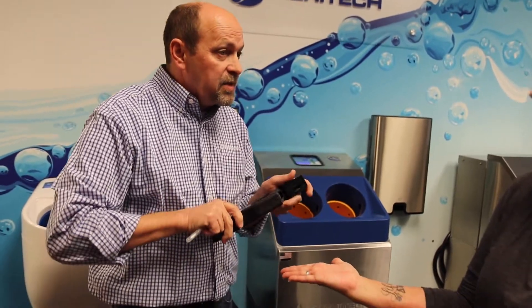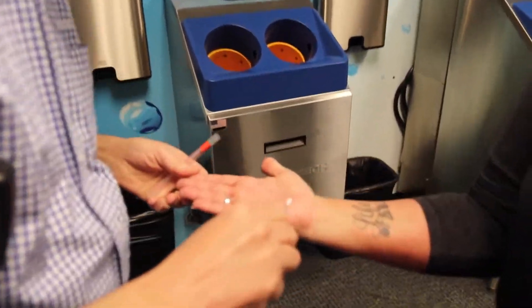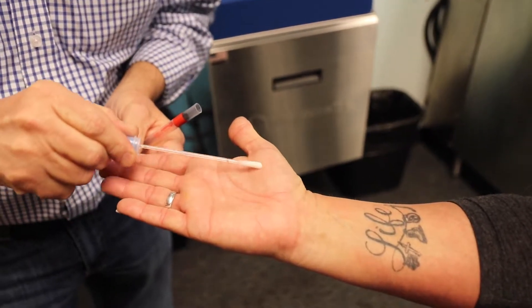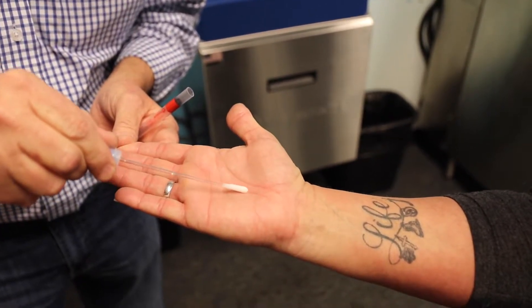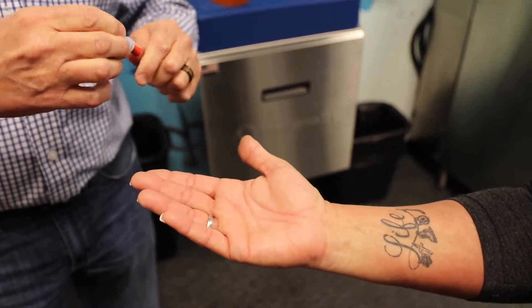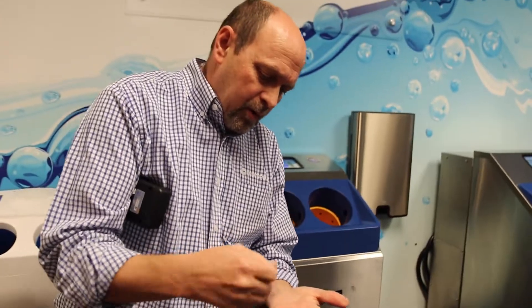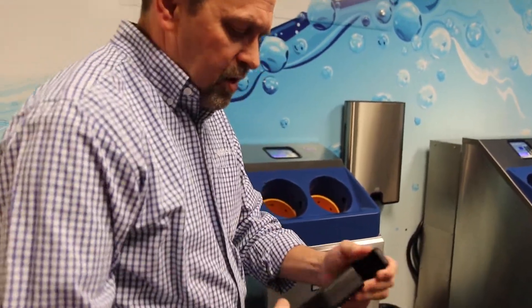We're going to color in that two-by-two square again, run the swab around, draw the square, put it back in, activate the swab and shake it again like a Polaroid, then run the test again.